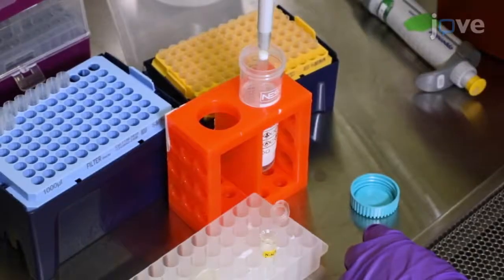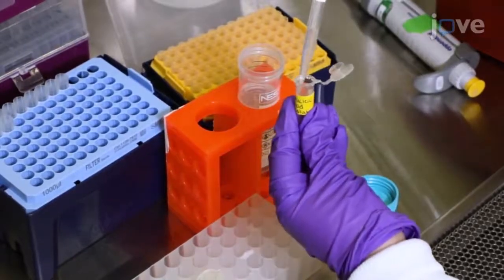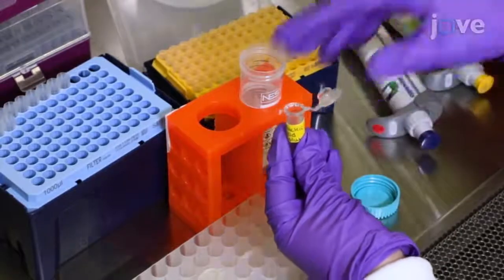Then add the appropriate amount of mRNA stock and dilute with citrate buffer to achieve a final volume of 1.5 milliliters at the desired concentration.